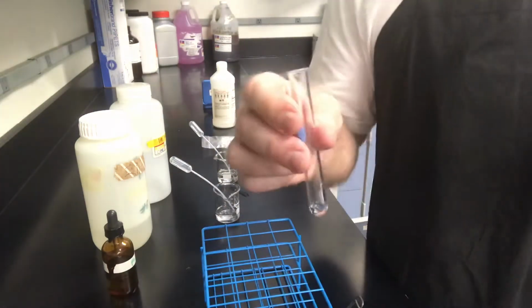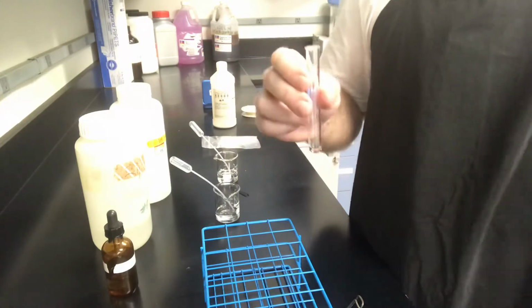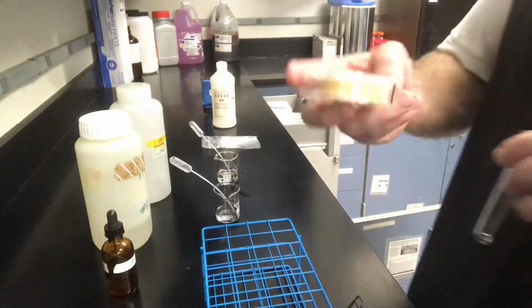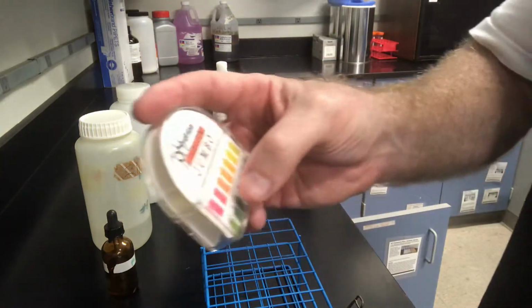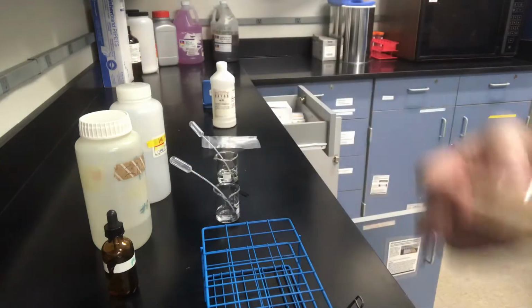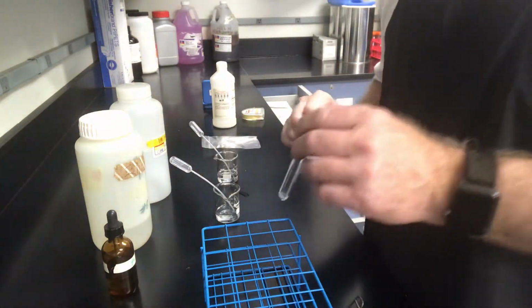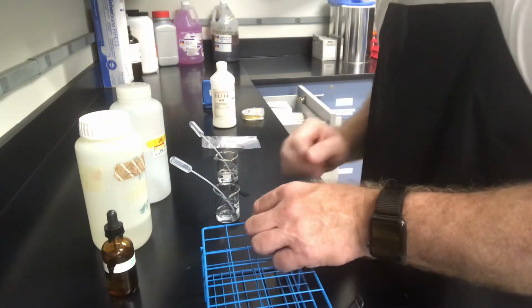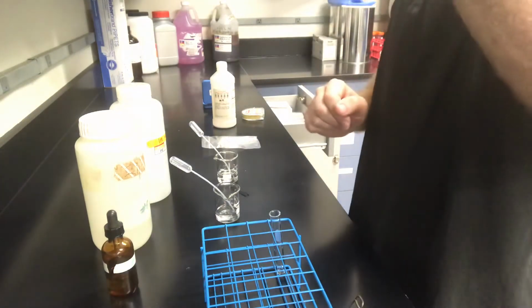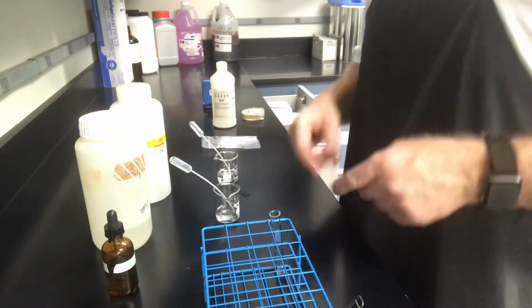We're just going to have to trust that it's just HCl. We know that's a strong acid. It is going to be acidic. My guess is it's right down around 2 on the pH scale. I've done this before, so you'll have to trust me on this. I don't want to mess with my results. So we have a pH reading: it's HCl, it's going to be about 2. You'll have to trust me on that. I suppose I can go back and do another test tube video and show that to you. But for now, keep going.